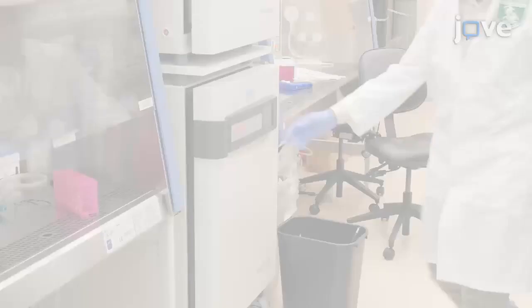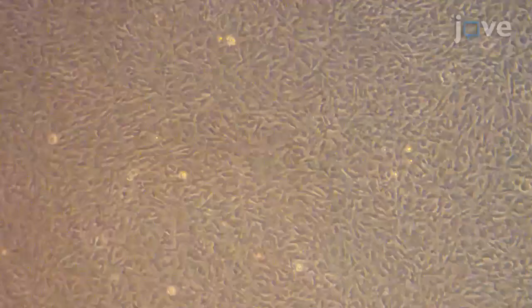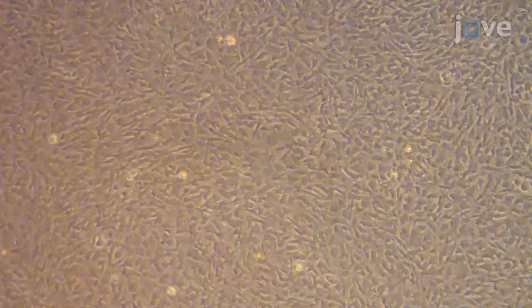To begin, culture OP9-DLL-1 cells in OP9 media at 37 degrees Celsius. When the cells reach 80-95% confluency, wash them once with 1X magnesium, calcium, and phenol red-free PBS.